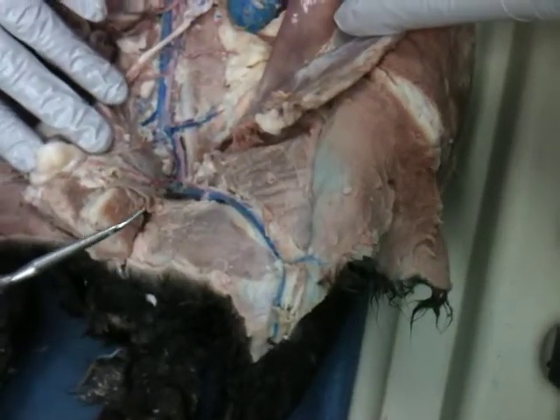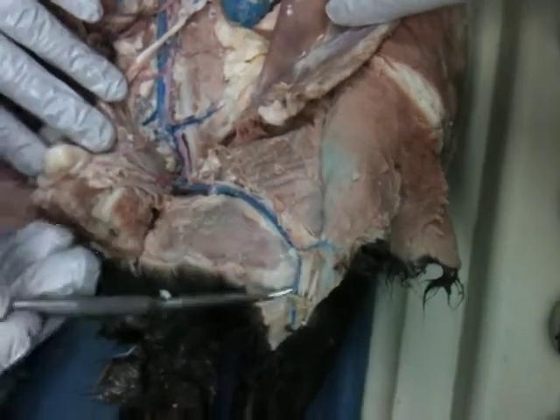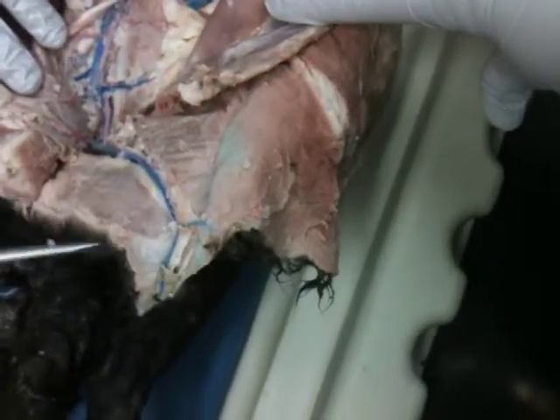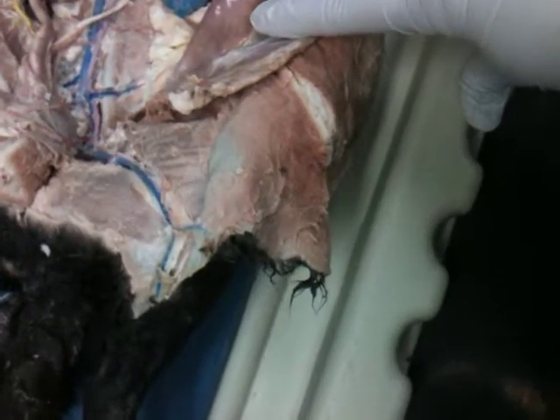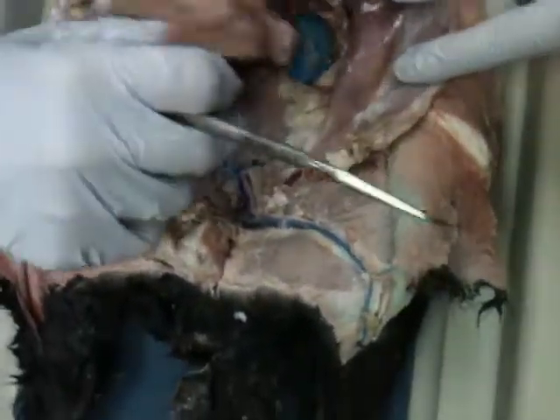Once it branches, it becomes the femoral, correct. And continuing on is the great saphenous vein. Anything down in this more distal area is the great saphenous vein, yes. And that's going to be on both sides of the leg. Correct. Okay. Any questions with that?